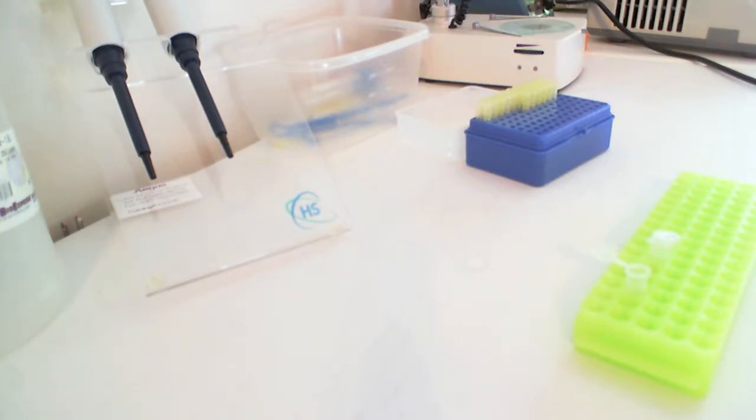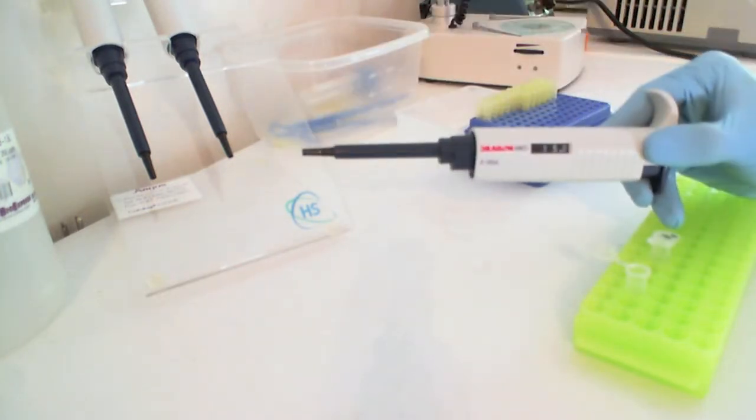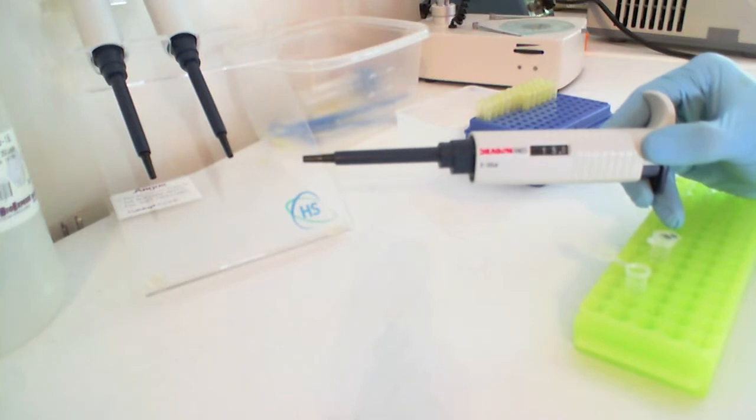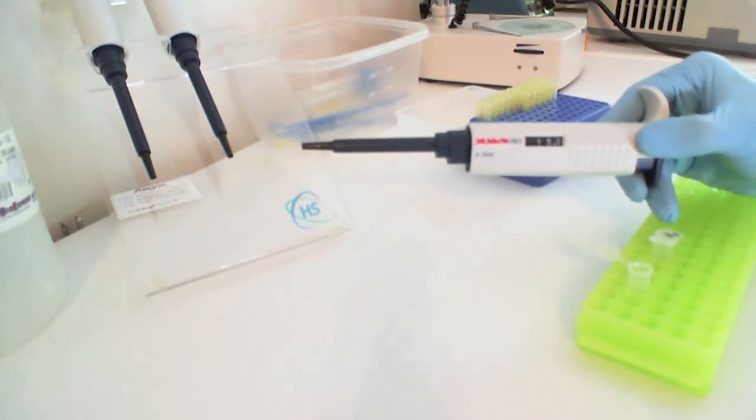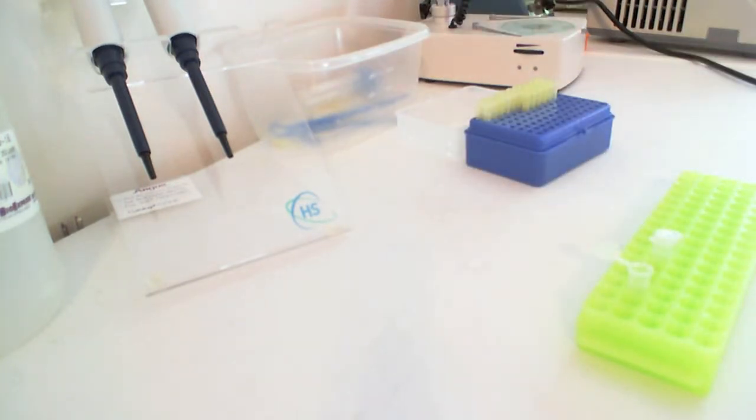The main tool that you're going to be using is the air displacement pipette. We use these in research labs to move liquids from place to place and I wanted to give a brief demonstration of how they work.